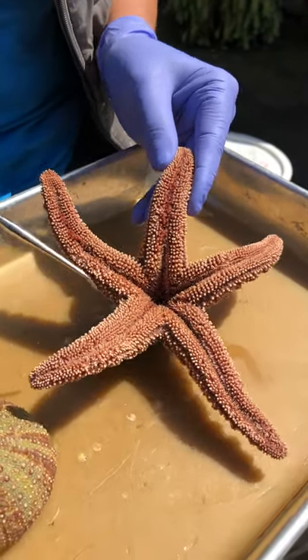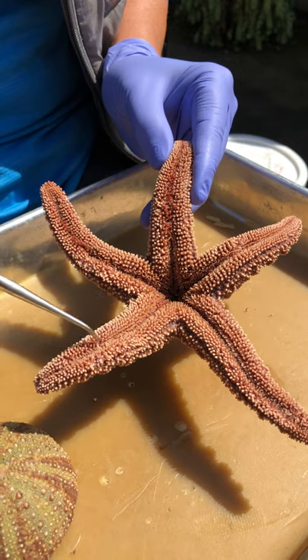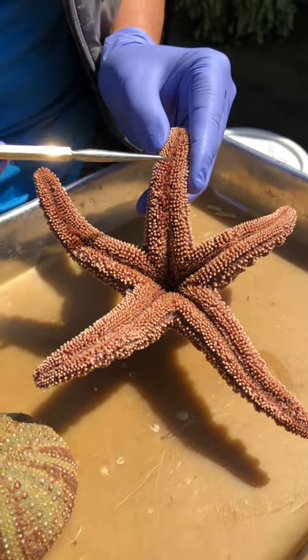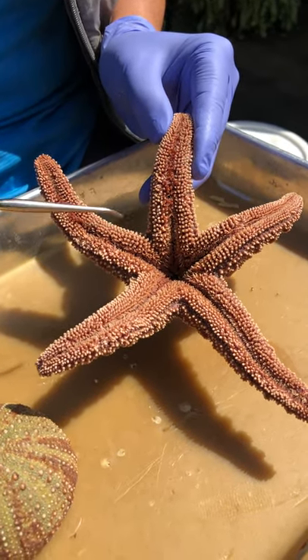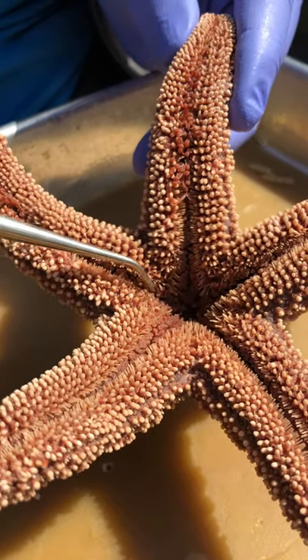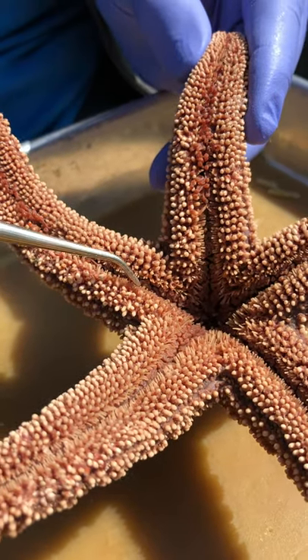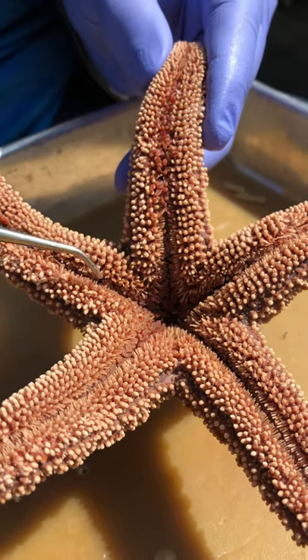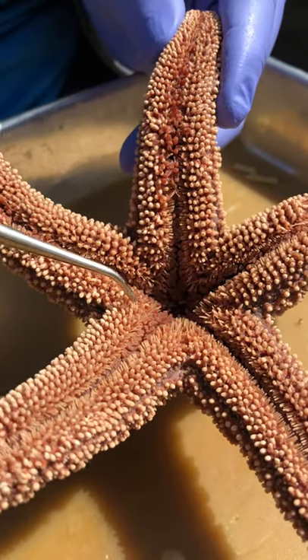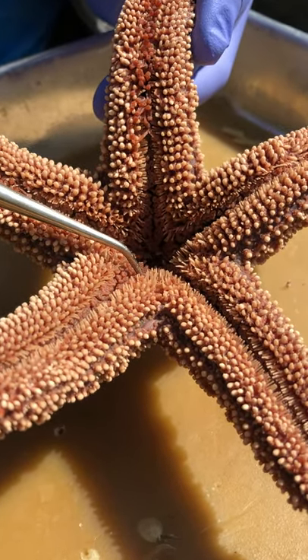Let's turn this over to the oral side. We can see that emanating from the mouth we have this really strong groove through the middle of the length of each of the arms — that's called the ambulacral groove. On either side of the ambulacral groove, you can also see that we have several rows of spines. For those of you doing echinoderms for your project, you know that's going to be a key character: how many rows of spines, how long are the spines, etc.